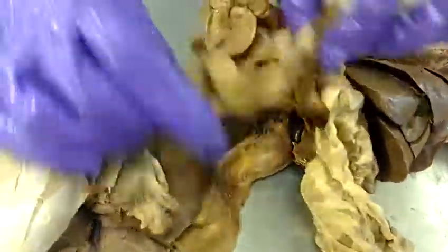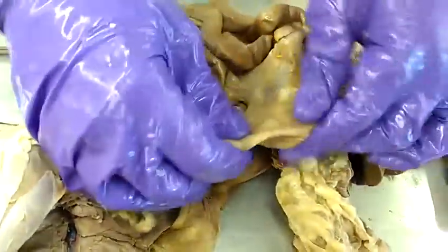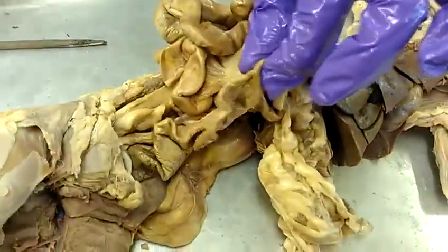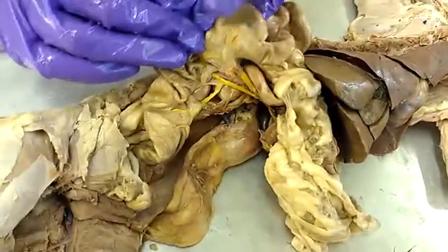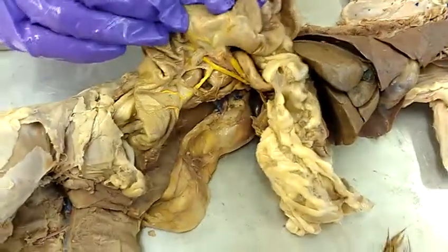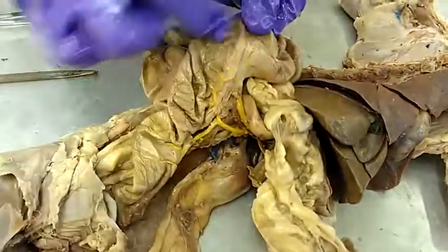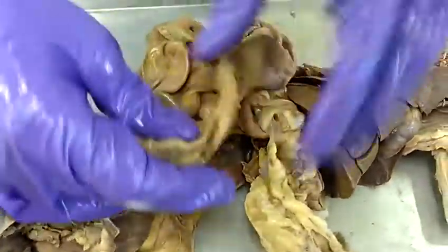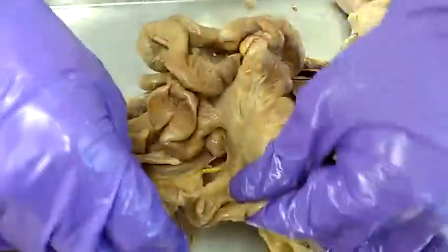The large intestine. And the cecum — the cecum is the beginning of the large intestine. We can tell because of how much wider it is.